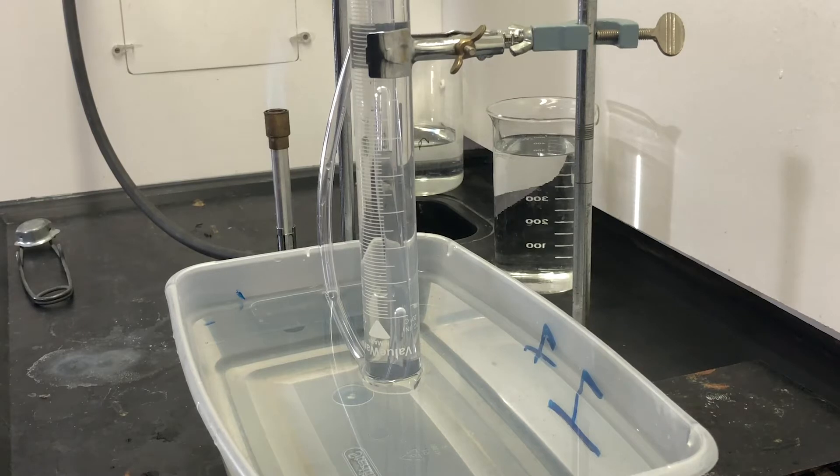Now the first bubbles of gas, it's just the expanded air. But after it reaches a hot enough temperature, the sodium bicarbonate is going to begin to decompose. And that decomposition is going to push carbon dioxide out of the sodium bicarbonate in the form of gas into the graduated cylinder.